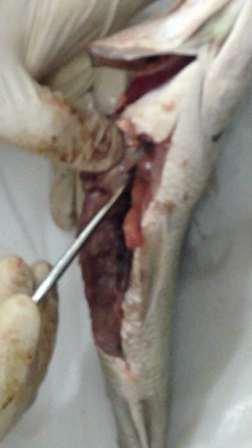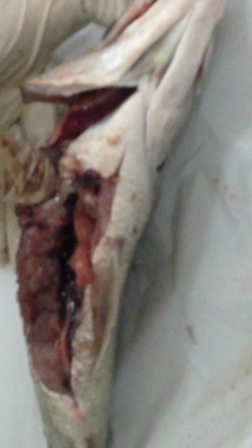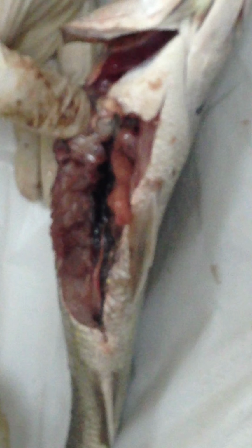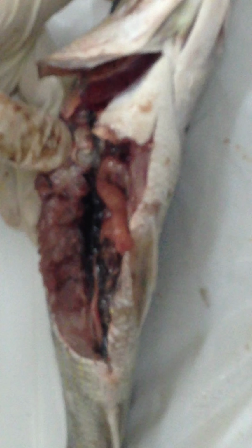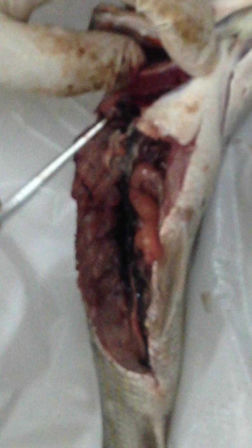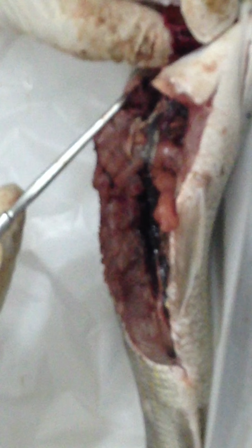One thing we haven't seen so far is the kidney. As we go dorsal to the swim bladder, you're going to find something like clotted blood along the vertebral column, and that is the kidney. The kidneys are located right above the swim bladder, so in order to see them, you will have to pull the swim bladder off the body wall. Some part of the kidney extends more cranially, and it's fairly large.